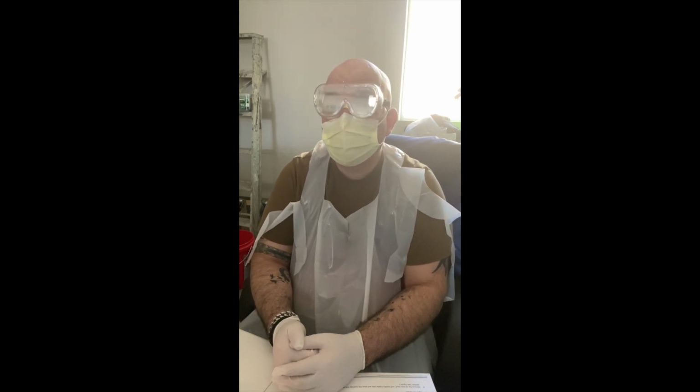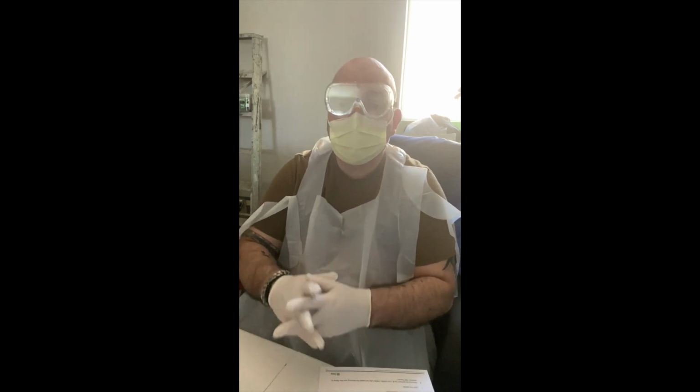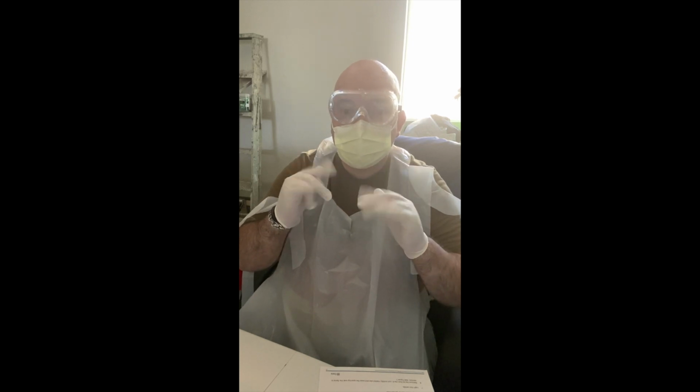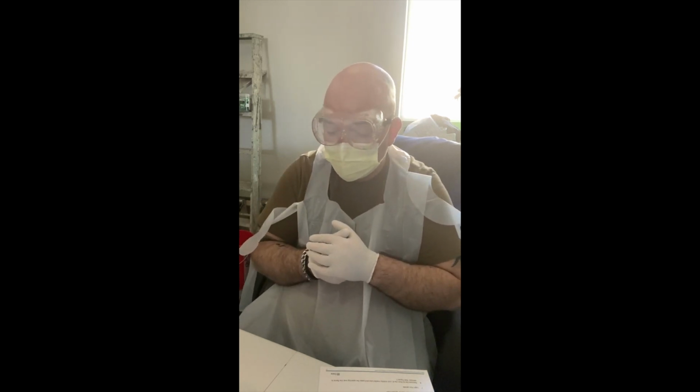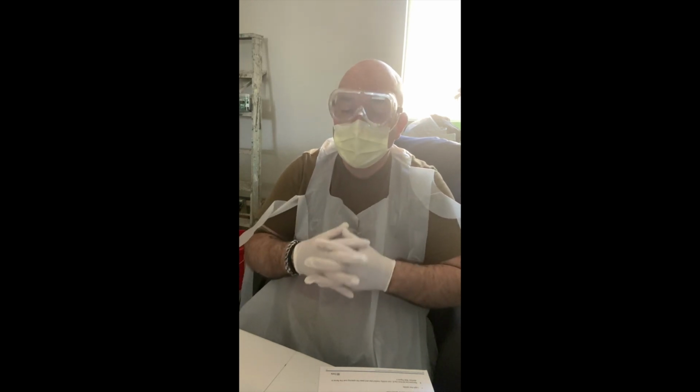So motility itself, of course, refers to movement. And we'll be talking about or seeing what's called flagella, kind of little hair-like extensions on bacteria, hopefully. This is a multi-day lab.